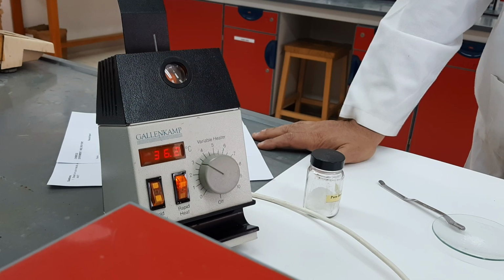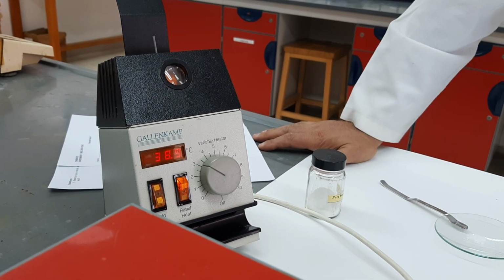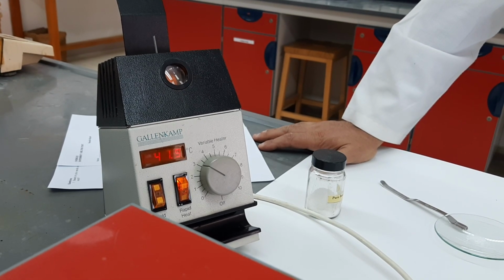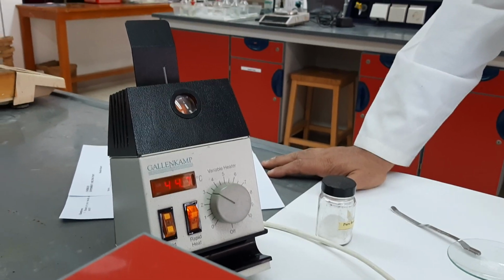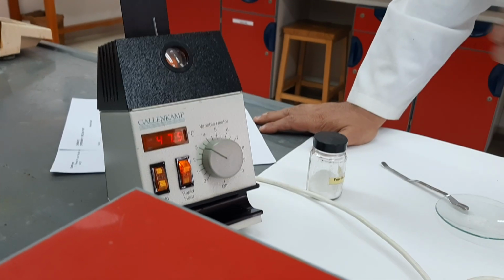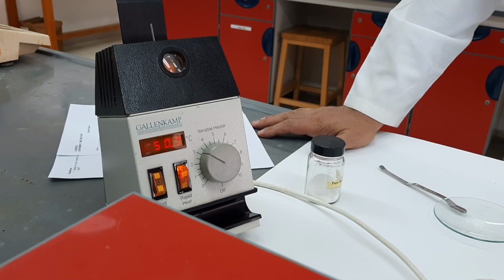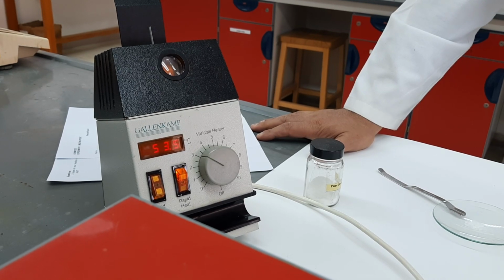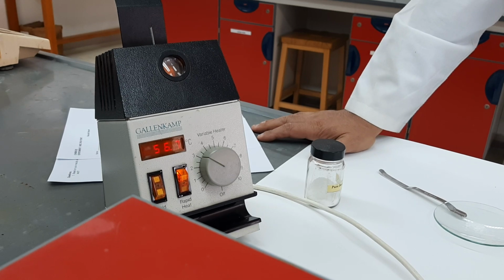So raising the temperature very fast, rapidly to 80, will not affect our measurement. We will definitely get an accurate measurement. So we let the temperature increase rapidly until it gets to 80. Then we turn the rapid heat off, and we allow the temperature to increase, but slowly, until the whole compound melts.